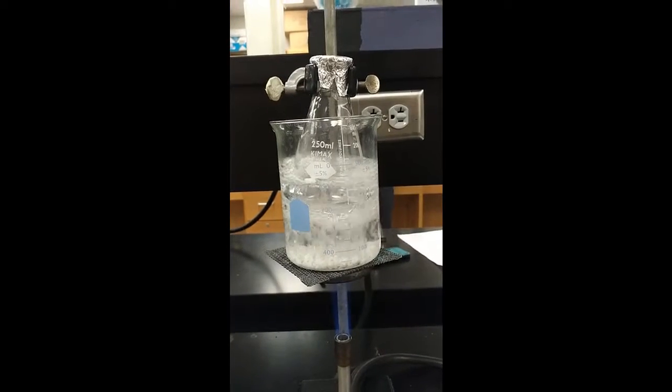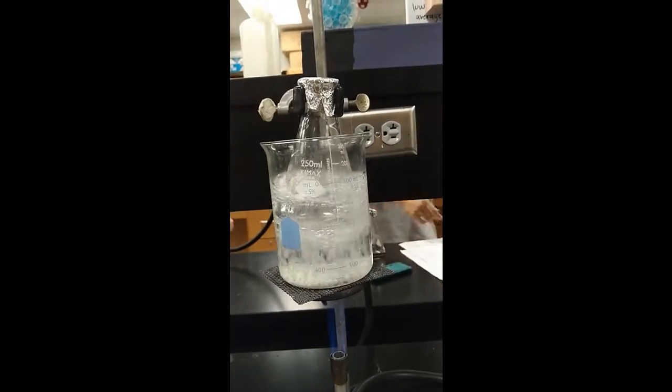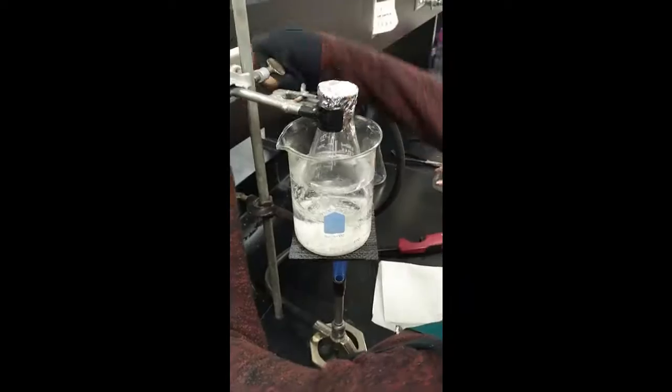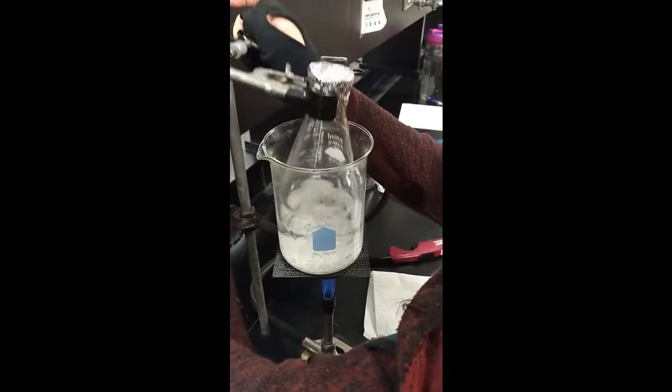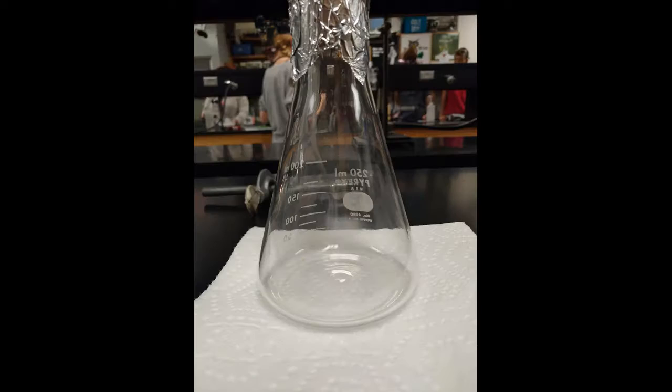Step 6. The liquid in the flask will begin to evaporate and excess vapor may be observed escaping the hole in the foil. Step 7. After 2 or 3 minutes, all of the unknown liquid should be vaporized. Then remove the flask from the boiling water. Use the clamp on the neck of the flask to protect your hands.